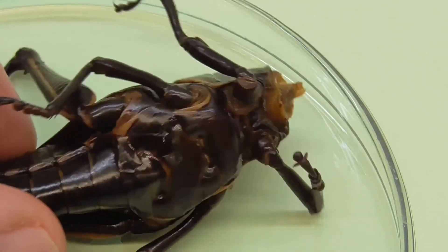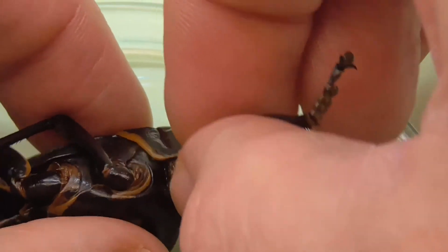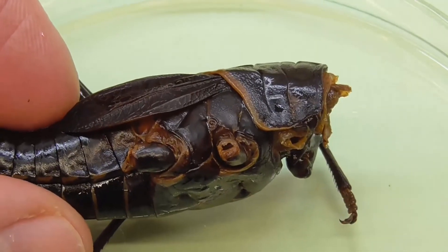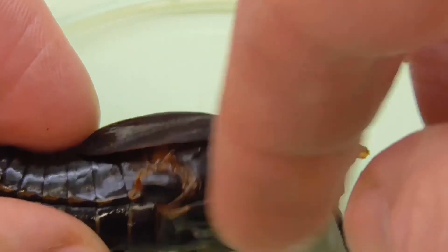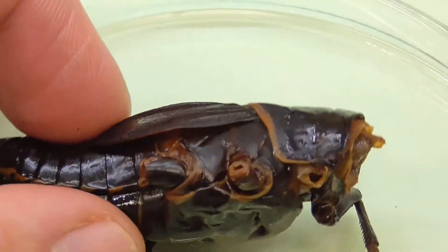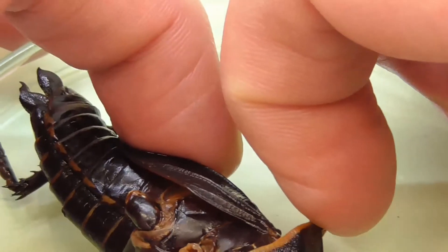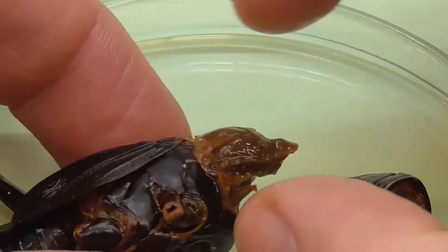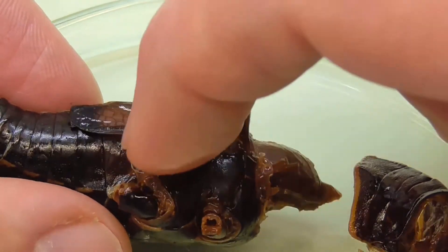Now, we'll take off the legs so you can see the thorax a bit better. You can see the prothorax, and note that this little shield actually extends over the mesothorax and the metathorax. The wings come off the second and third segments — on this particular animal the prothorax is protecting the wing bases. If we take off that prothorax, we can see the first pair of wings comes off the mesothorax and the second pair comes off the metathorax.